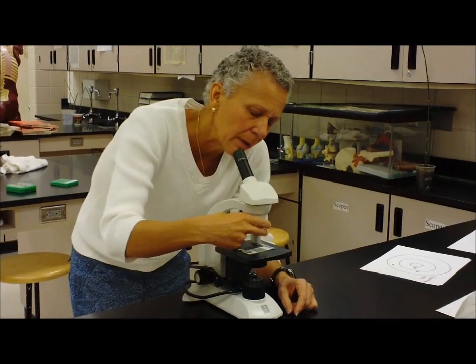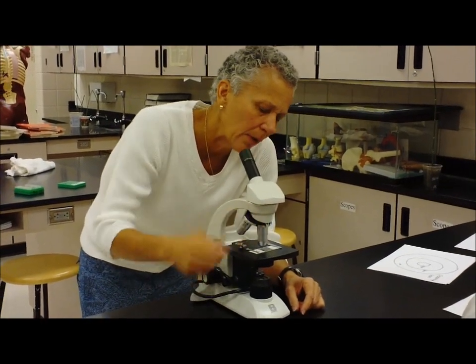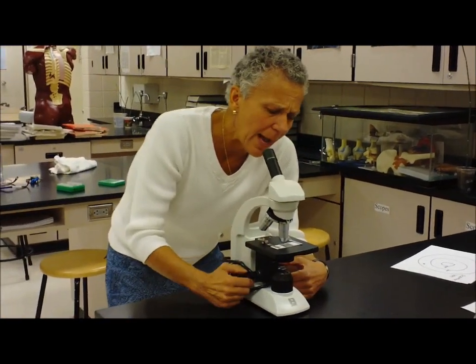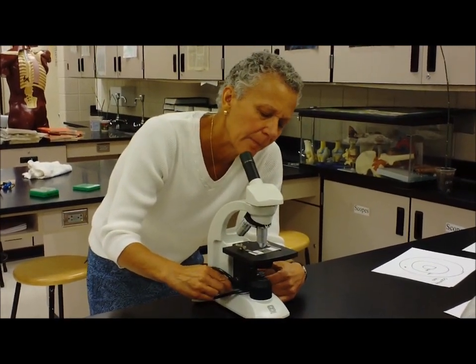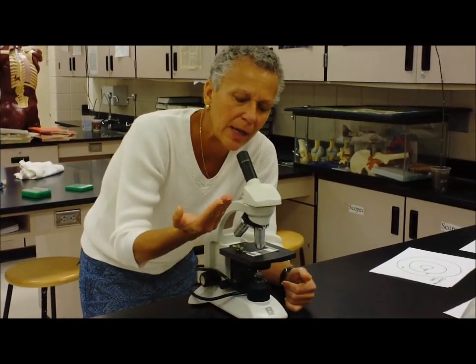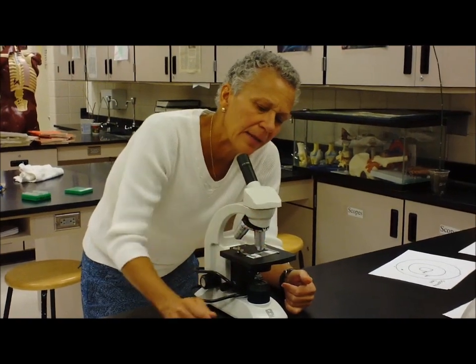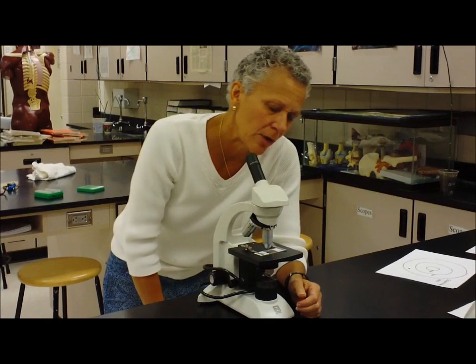Again, center it to the middle, and then switch to the high power lens. When we're using the high power objective or lens, we only use the fine adjustment knob. You don't want to push the stage into the lens, damaging it. And if the scope is working right, that's all that you should need.